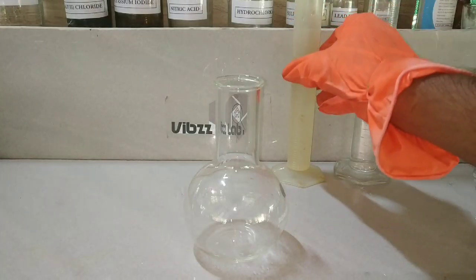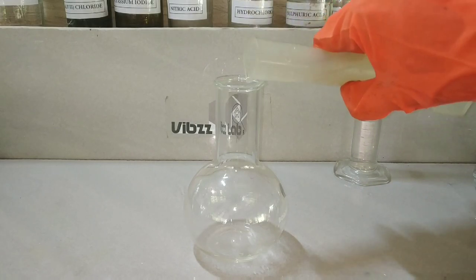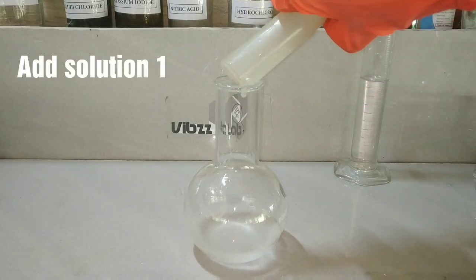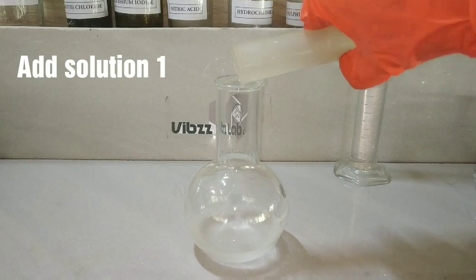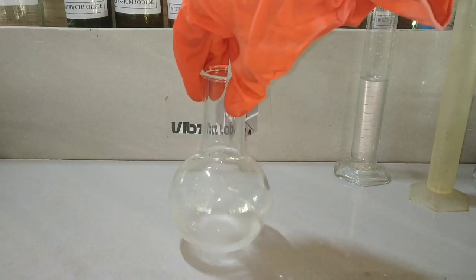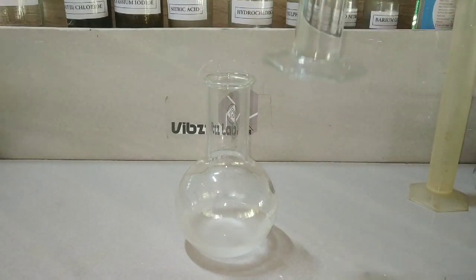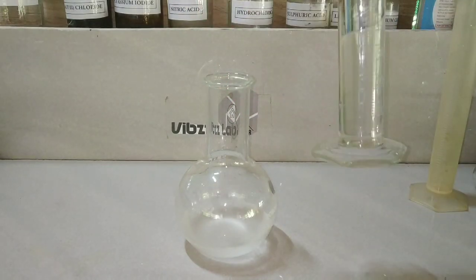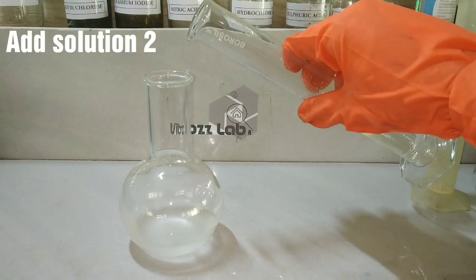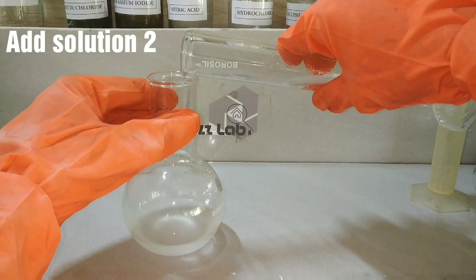Now we will be seeing the chemistry in action. I have taken a 250 ml flat bottom flask and have added solution 1 into it. Solution 1 contains 25 ml of 0.5 molar potassium iodide, 25 ml of 0.05 molar sodium thiosulphate, and 2 grams of soluble starch.